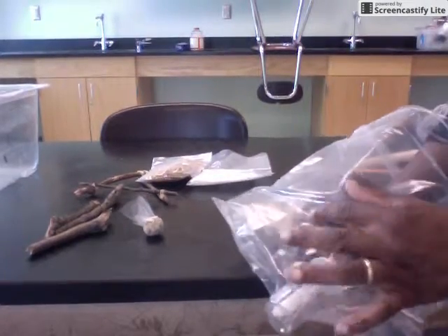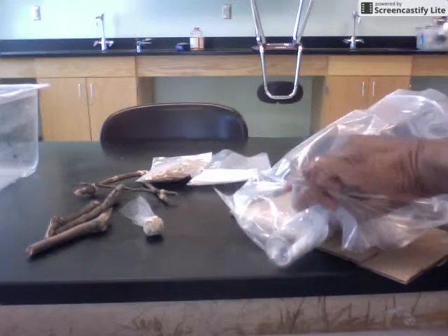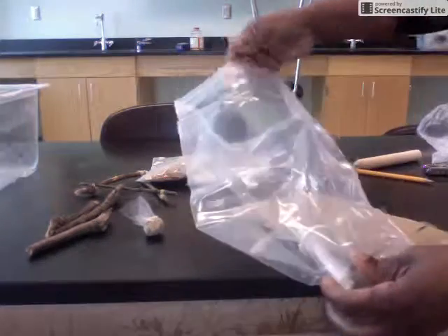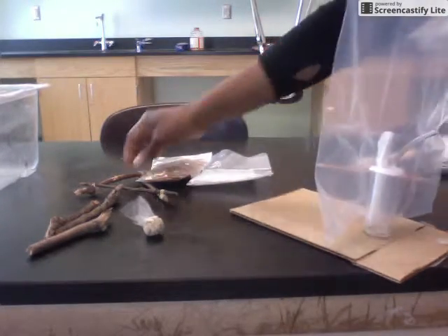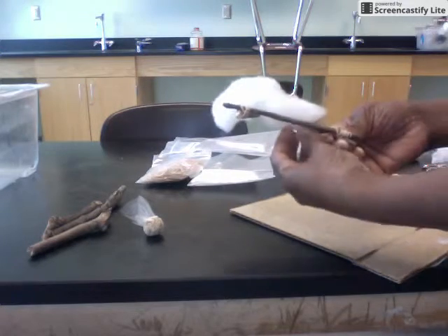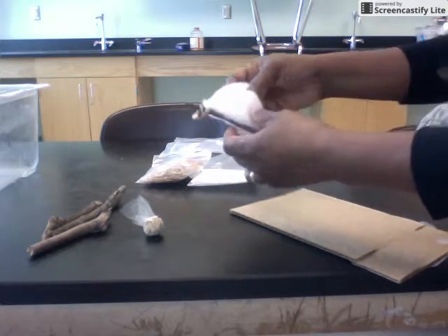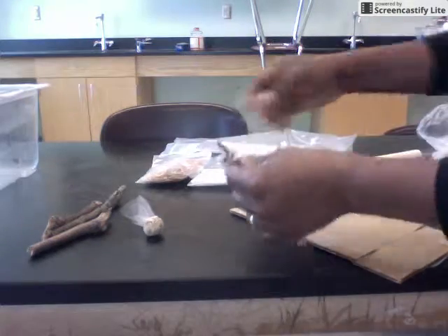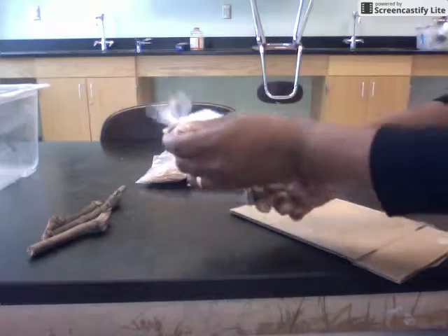I ask students to work in teams — one holds the bag while the other uses the pencil to poke the hole. Once the hole is made, push the tube through. We will use a syringe to fill the water fountain and replenish it as needed. Once completed, we take the climbing structure and make it a comfortable environment for the milkweed bugs — as close to home as possible. The inside of a milkweed plant has a nice fluffiness to it, so we replicate that. Then we attach the food sacks to the corners of the structure.